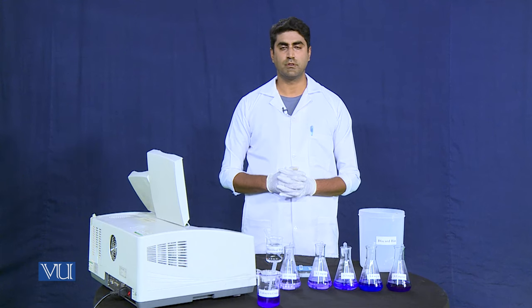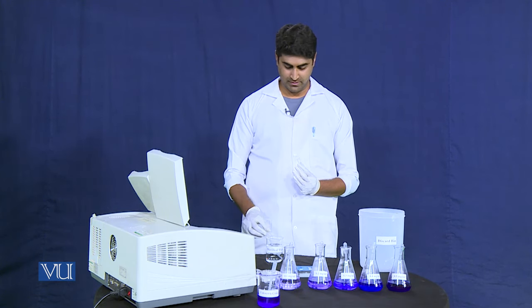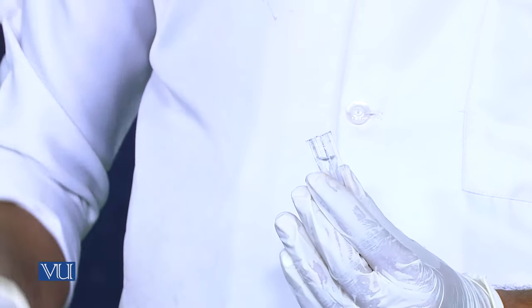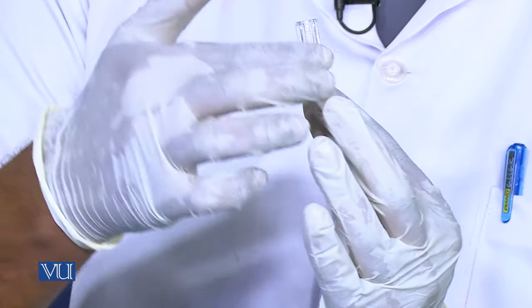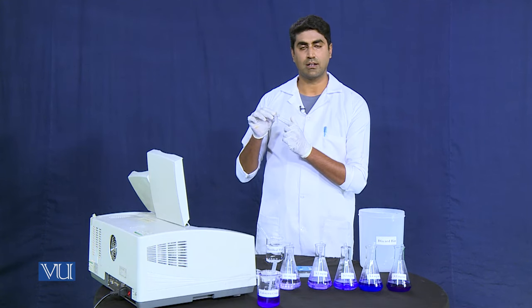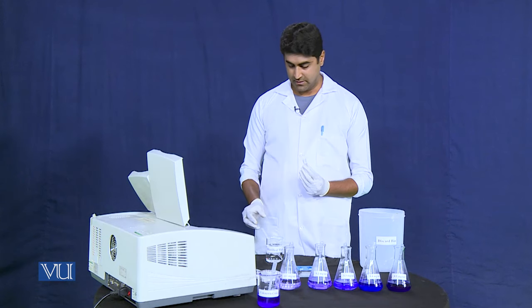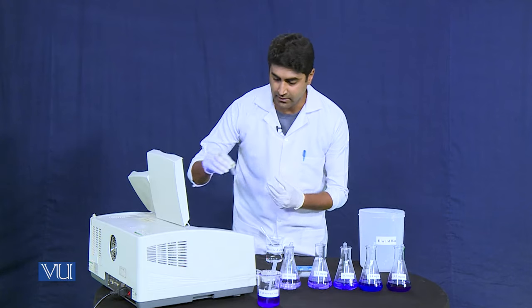For quantification of potassium permanganate, first we will run the reference test by adding solvent into the glass cuvette. We need to take a precaution: the cuvette has two opposite transparent sides and two opposite opaque sides. While placing it into the holder, the transparent side of the glass cuvette must face the light beam of the spectrophotometer. We will add the solvent and place the cuvette into the reference holder.